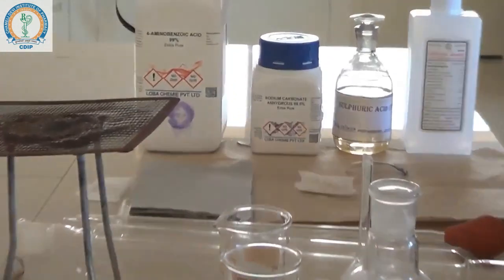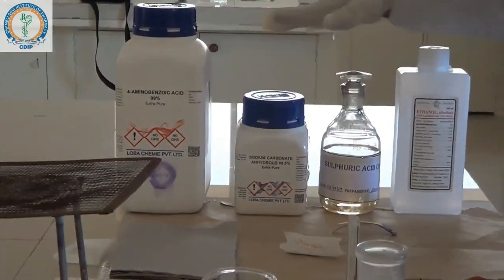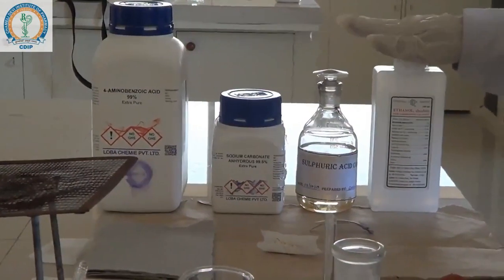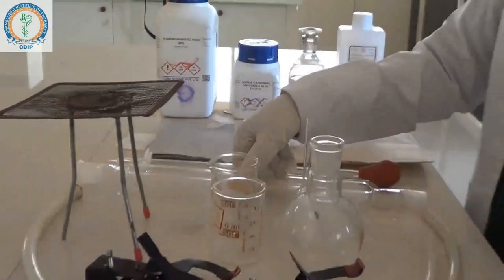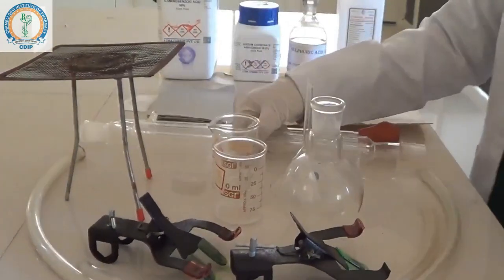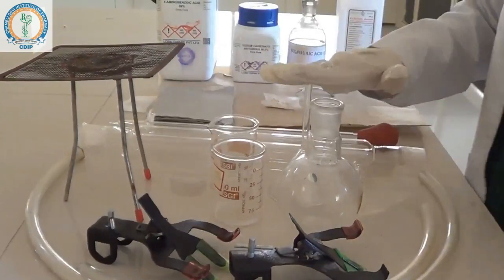For the glassware, we are going to have a condenser, some pipettes, funnel, and beaker.